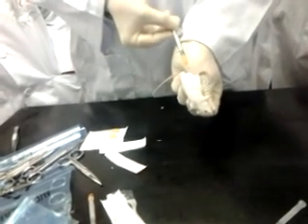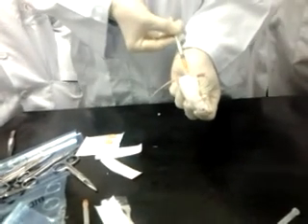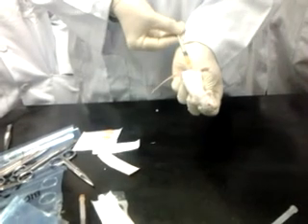Remember the bevel face up, recumbency. Insert this way. Remember this is 1 inch. You don't want 1 inch, we want only about less than half an inch inside, or less than a quarter of an inch. Place inside, and then we pull the plunger. Can you see there, airtight? The air bubble or not? A slight air bubble, but there's nothing inside.